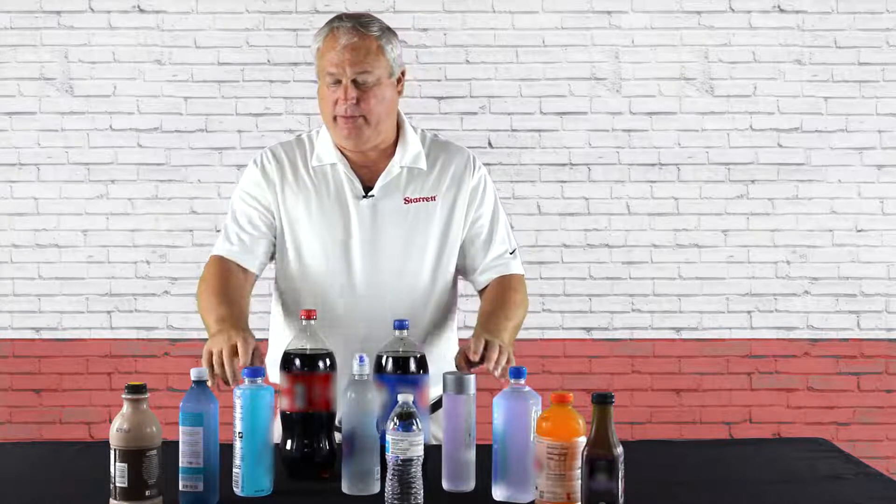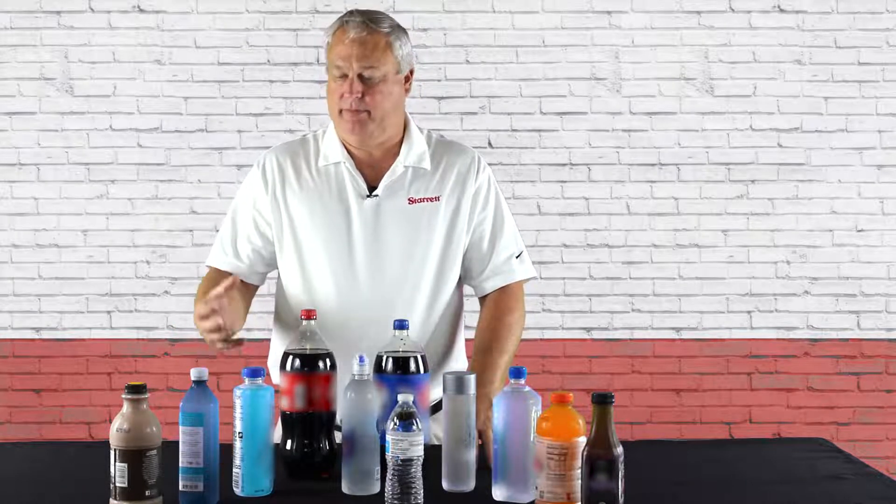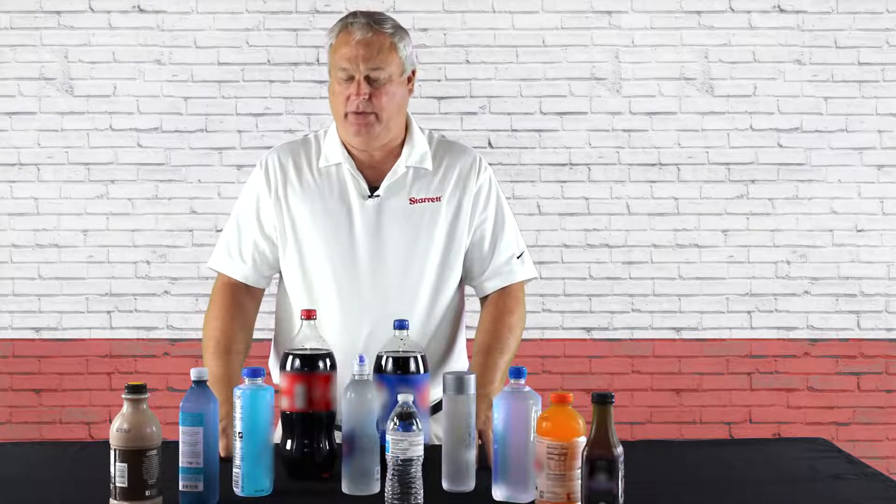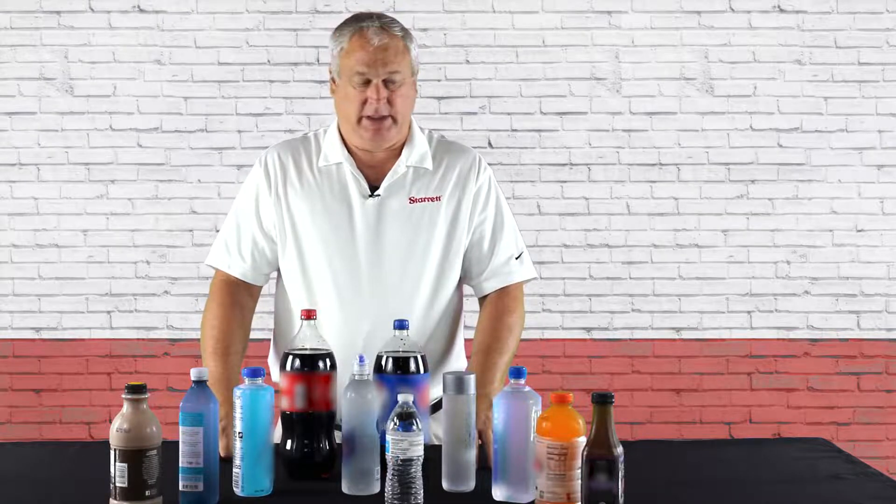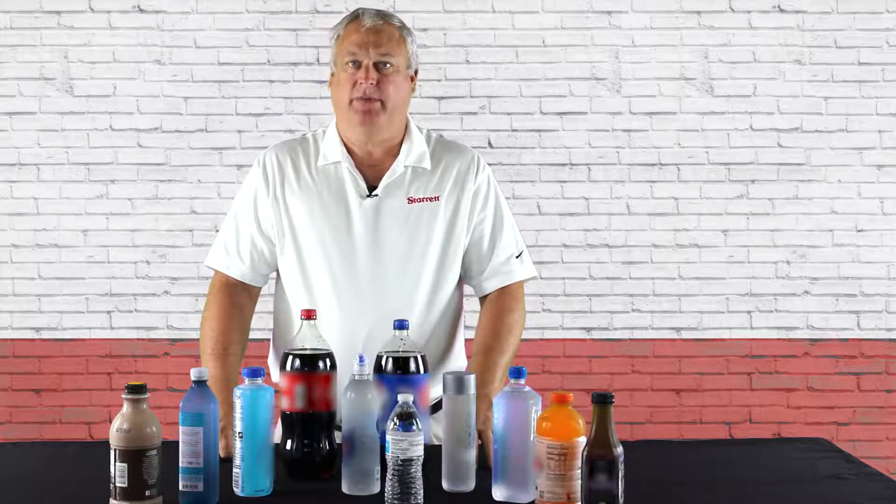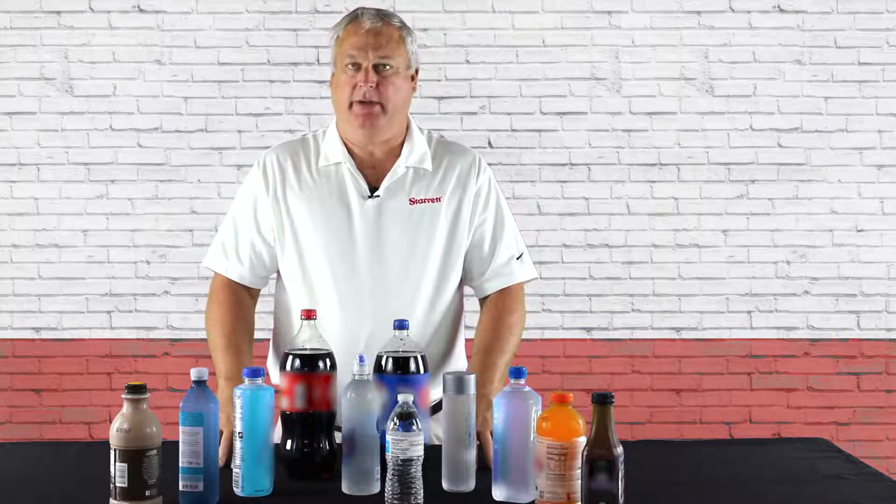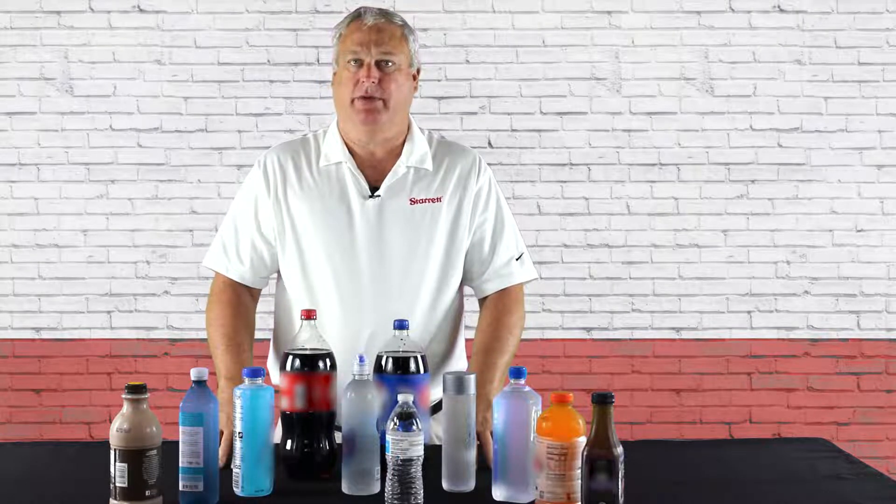Round bottles obviously are made for easy handholds and each one will test differently. We're not going to test them all but we will test a variety of the different bottles in the next series.